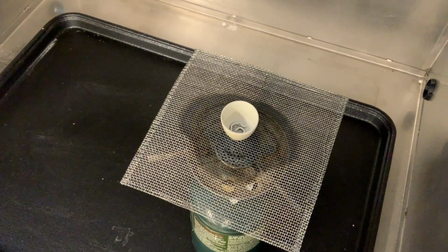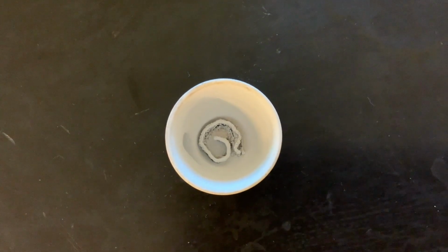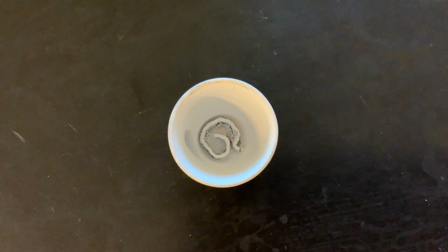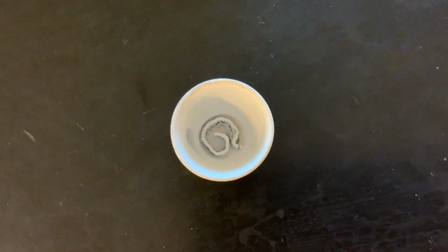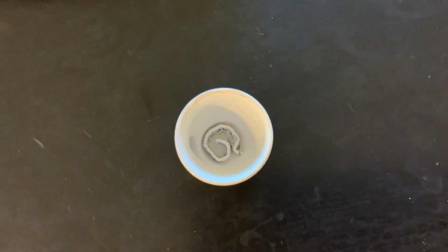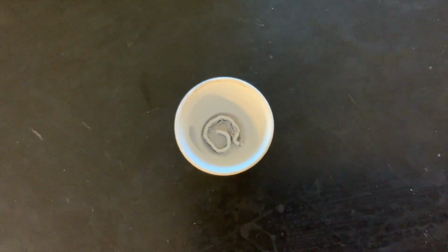The reaction is taking place. We're going to let the crucible cool for a couple of minutes on the countertop here before we take its mass. But I want you to take a guess now. Do you think it's going to weigh more or less after that reaction? Think about what it means to be a synthesis reaction.